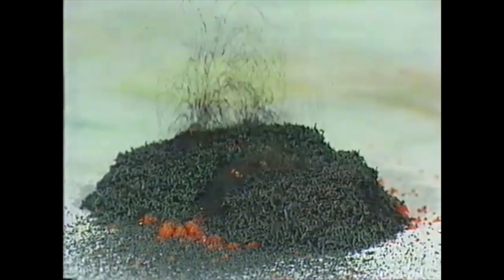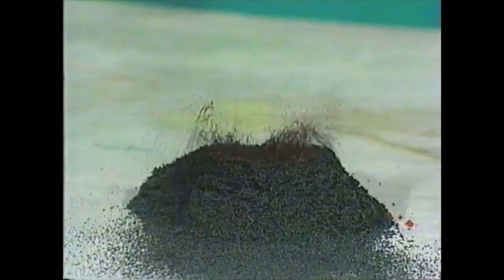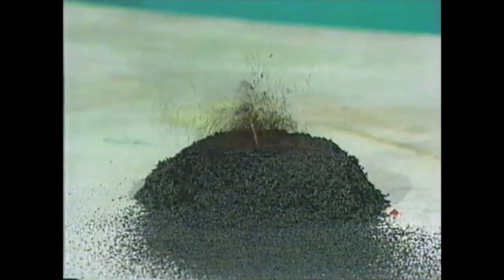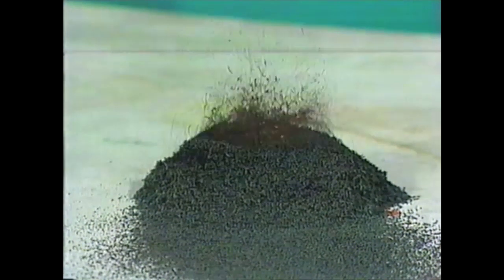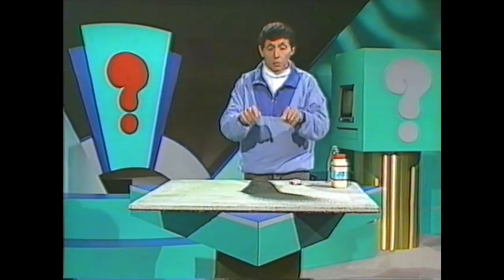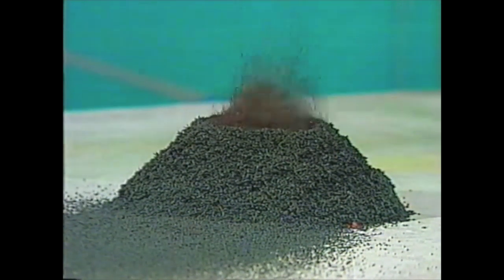There are actually two openings to the cone in our little model volcano. Now they've merged together and the whole thing is becoming larger and larger — it's now about four times the original size and still going. You can see the ash and other material falling down the outside of the cone, making it grow higher and wider. It'll keep doing this until all of the ammonium dichromate has been used up.